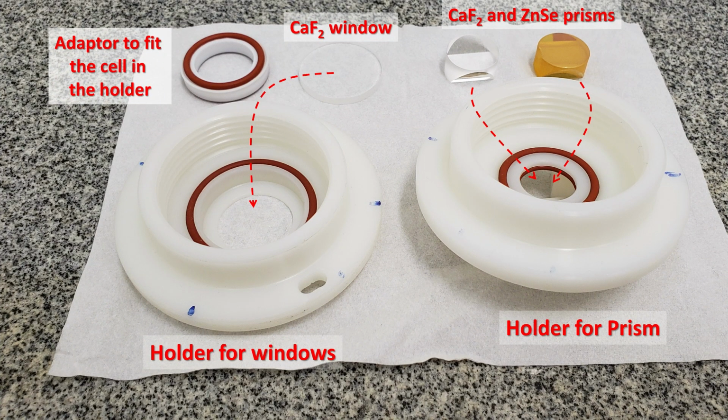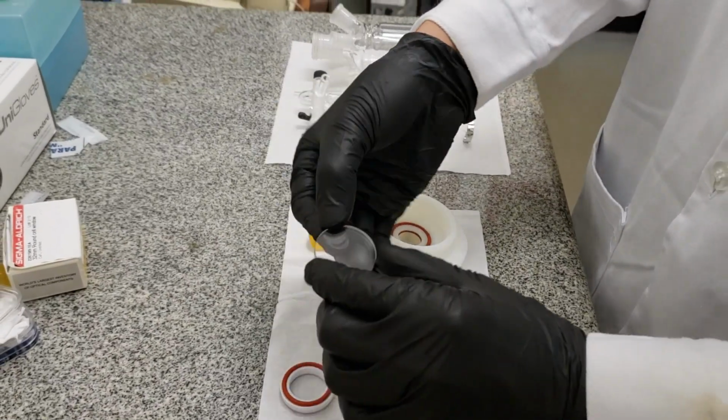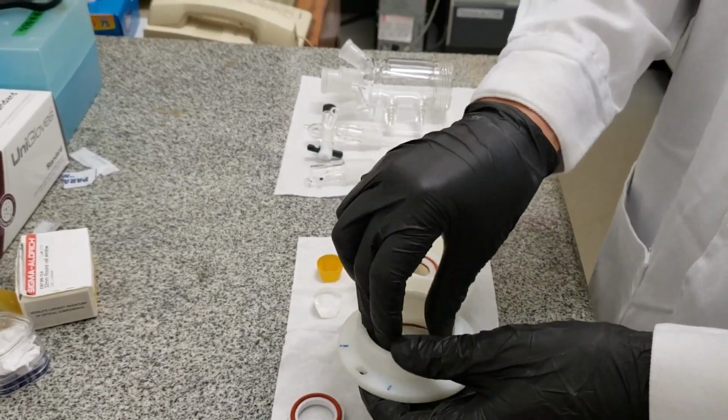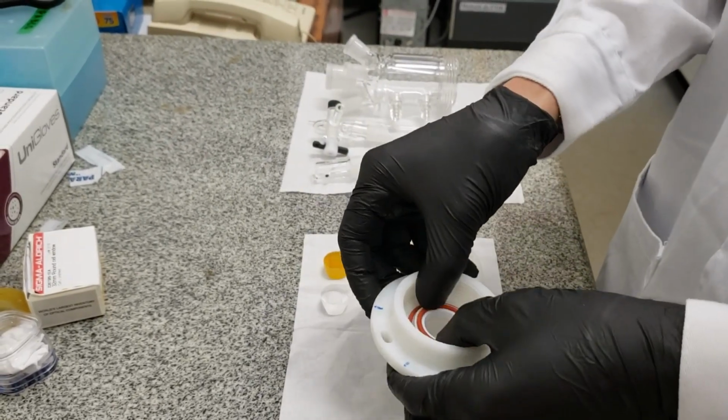In this figure, you can see the components of two different holders. One was designed to work with windows and the other to use prisms. These holders are meant to mount some of our homemade glass cells that we use in different kinds of experiments. That is to say, in spectroelectrochemical experiments, in photospectroelectrochemical, and using different configurations. The video shows how to set the holders for the window, which is rather similar to that for the prism.